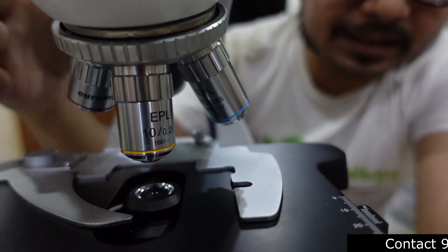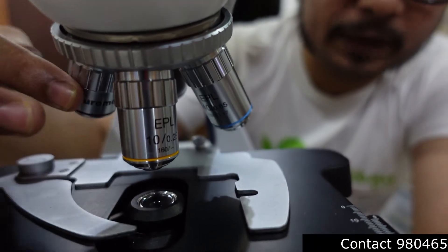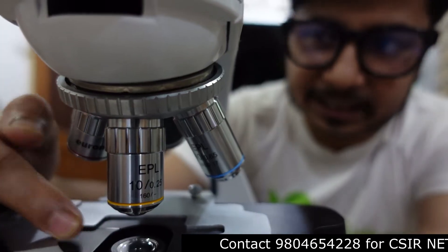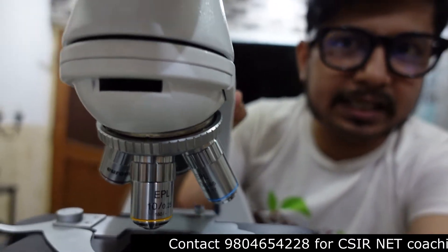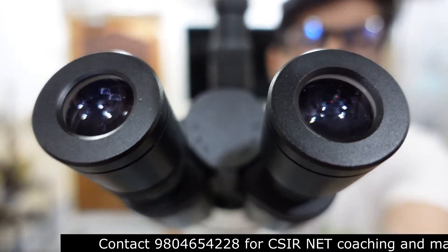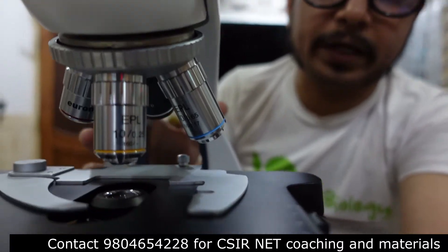This is where the lens structure for actual magnification begins. The nose piece holds the lenses — in this model, four different lenses are fitted. This is known as the objective lens, which magnifies whatever object you place on the slide. After the objective lens magnifies it, it is further magnified by the eyepiece. There are two eyepieces — left and right — that further magnify the object.